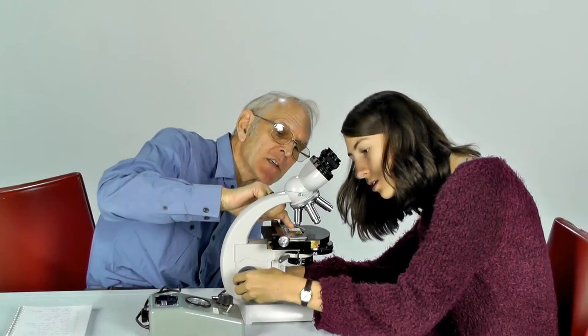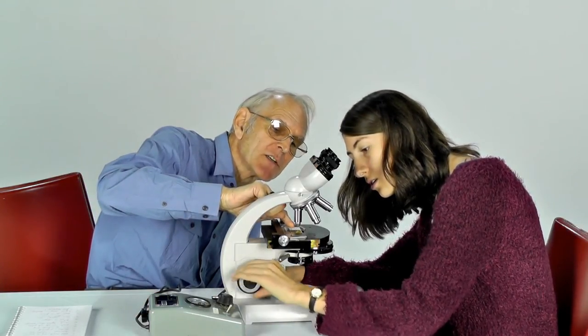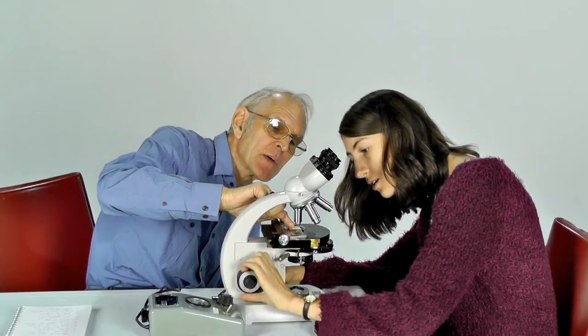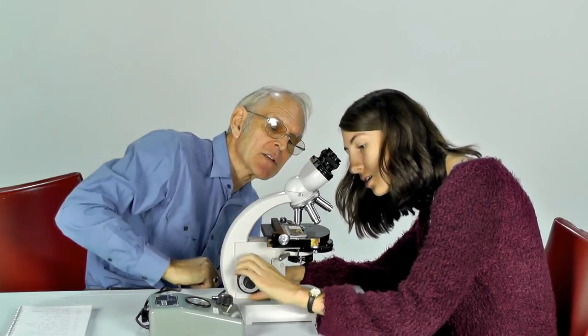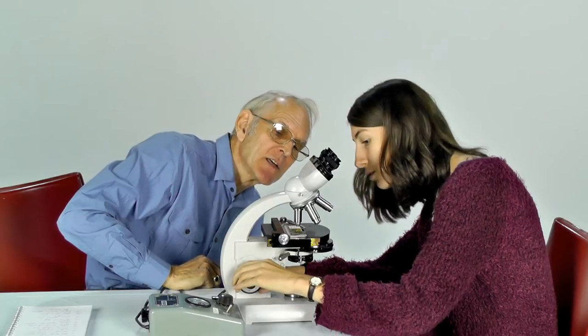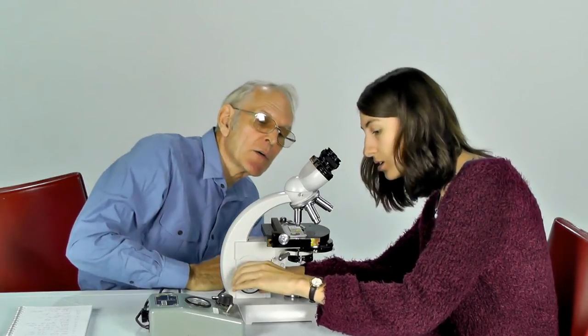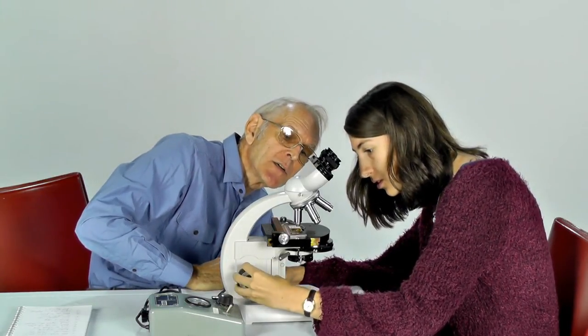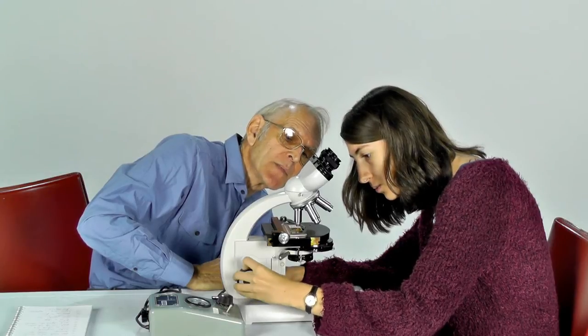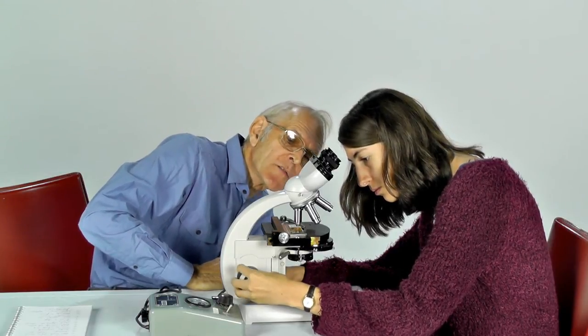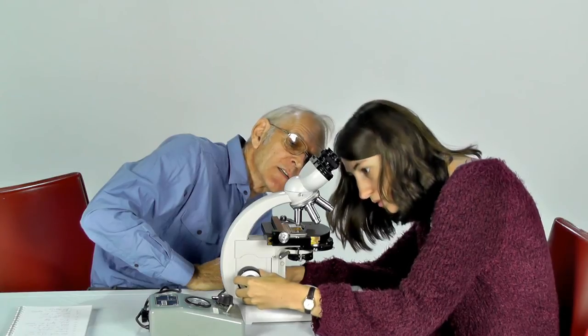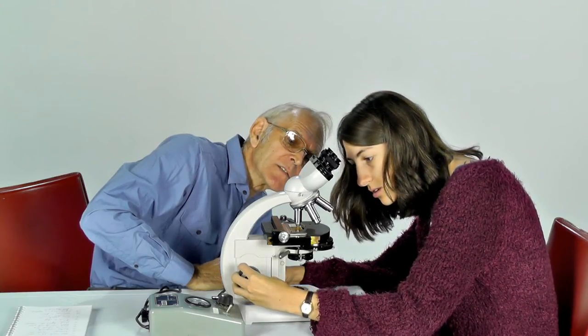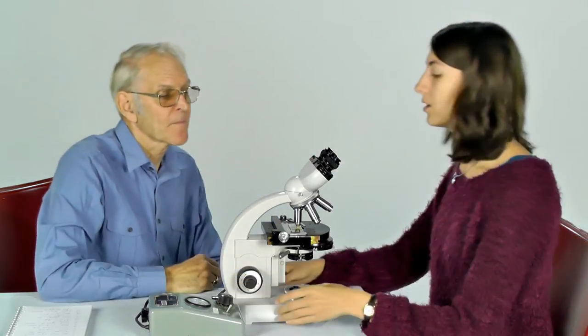Watch carefully to make sure that you don't smash the specimen into the objective lens. How close do I want it? Well, you can go either until the stage stops moving or until you're within about three or four millimetres of the lens. Does that look okay? That looks fine.